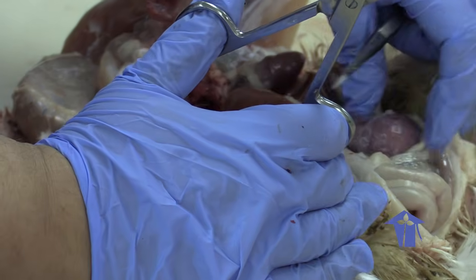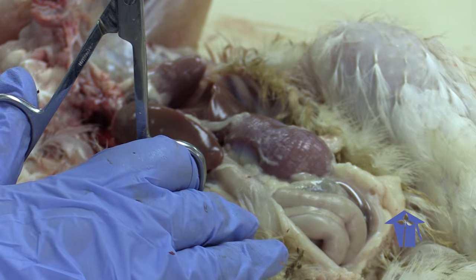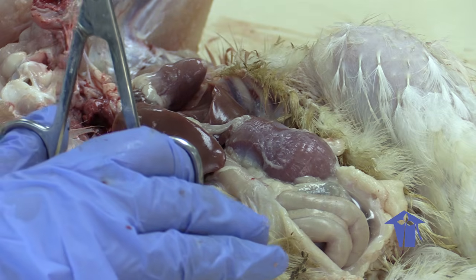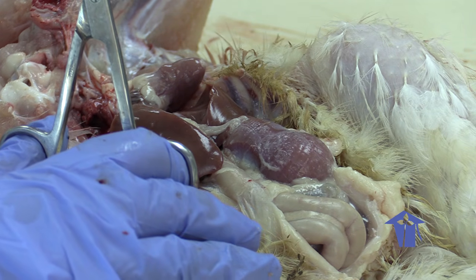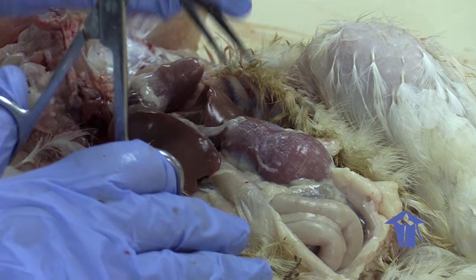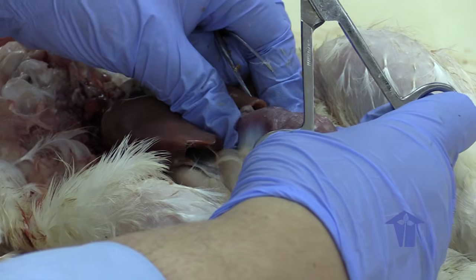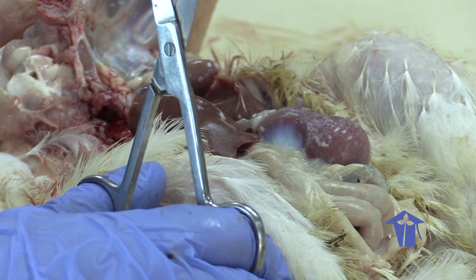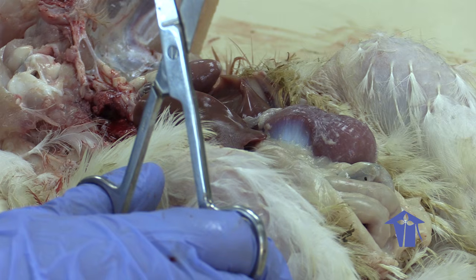So I was talking about the gizzard. What this gizzard does is it basically replaces teeth in the digestive system of the chicken. We break our food down by chewing, but birds do not have teeth. So they will ingest stones and store them in this very muscular sac called the gizzard. If you've ever eaten gizzard, you know that it has a very chewy texture, because it's very muscular.